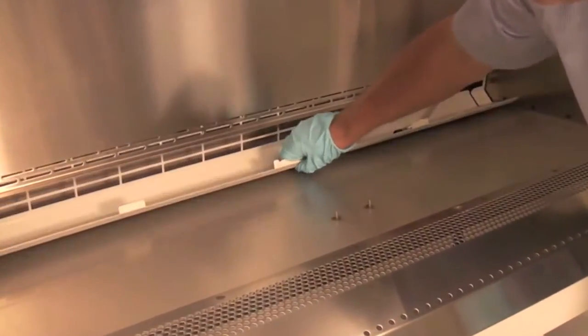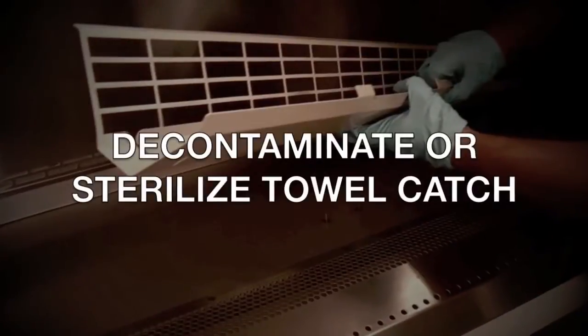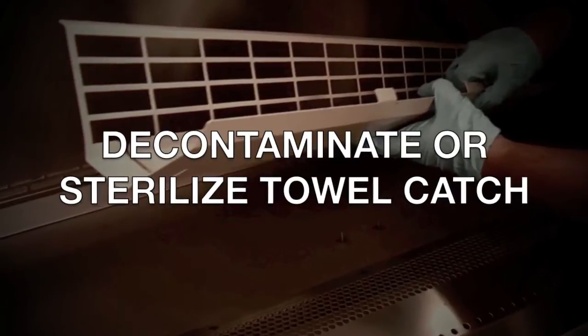You can now rotate and pull the towel catch from behind the inner wall. Do not remove the towel catch until it has been decontaminated and or bagged for sterilization.